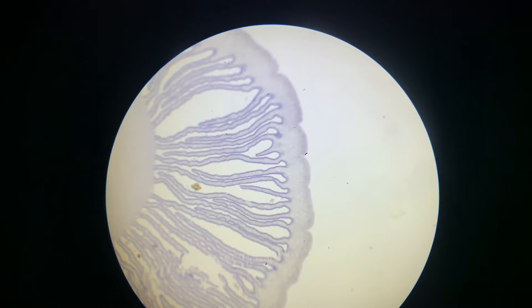That's exactly how you view your microscope: make sure the ocular lenses are set, make sure the binoculars are at the perfect setting for you, adjust that left eye after you've got the right eye straight and precise. I really just wanted to shout out the girl who asked me that question — it took me months to figure it out but I finally got it, and I really appreciate you for asking.